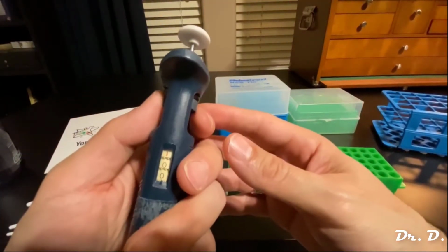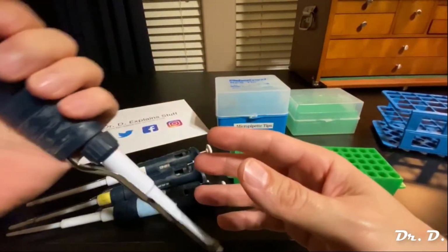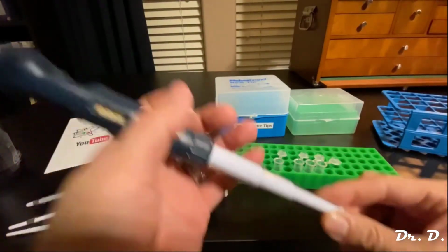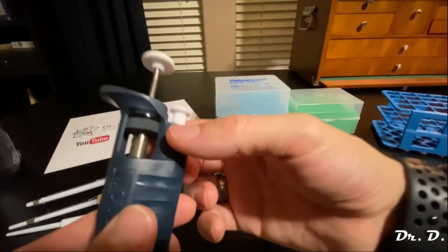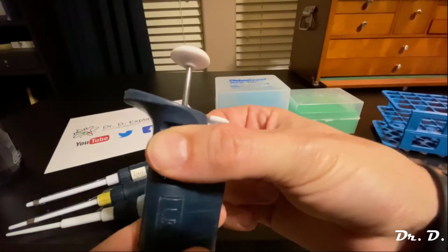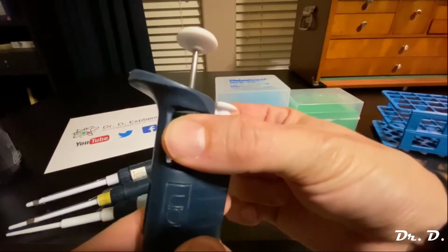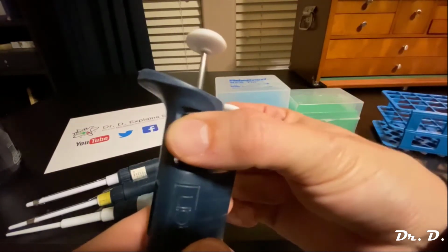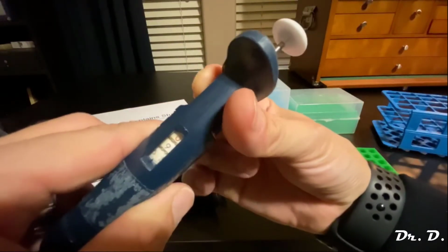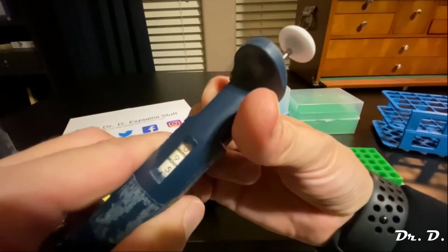So how would I get it down to 500 so I can make sure I aliquot only 500 and I'm not aliquoting more than 500? So there's a black wheel right here. Okay, this wheel spins. Notice how, watch this, see? If I turn it, it spins. And when I'm turning this wheel, the numbers are moving on the little scale here. The settings are changing.